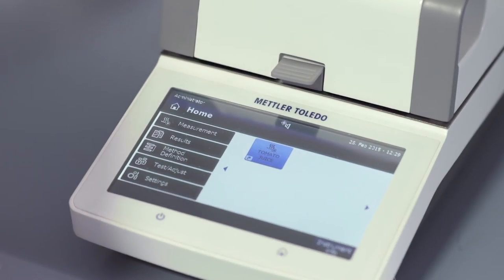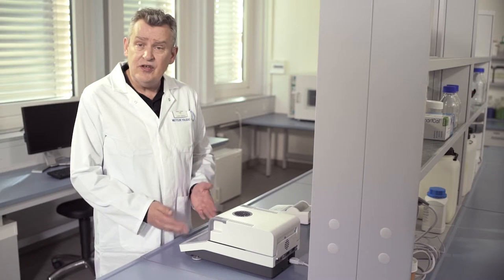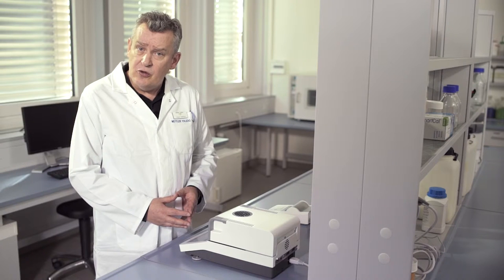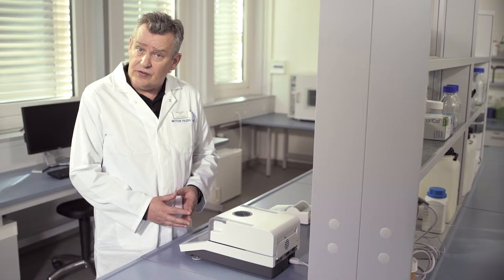These are the most commonly used functions of the HC103. And as you can see, this instrument is really easy to use.